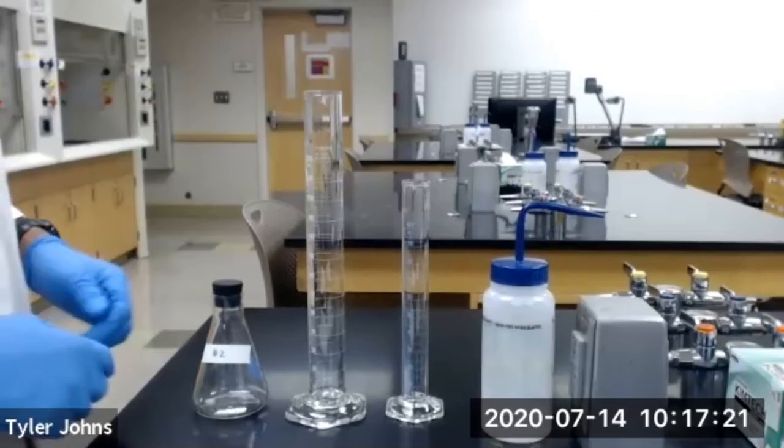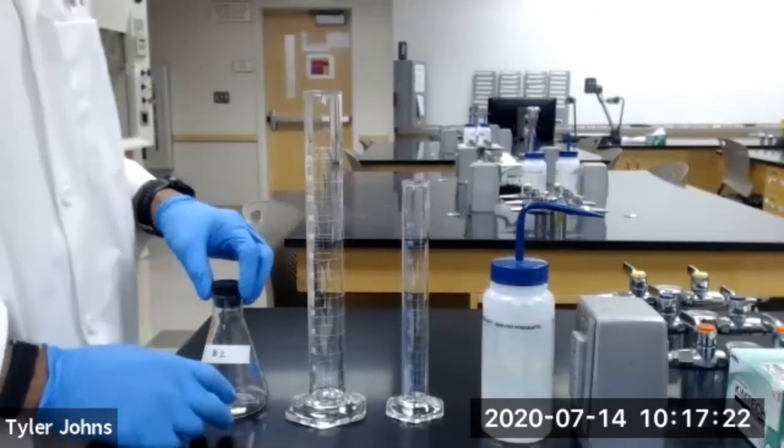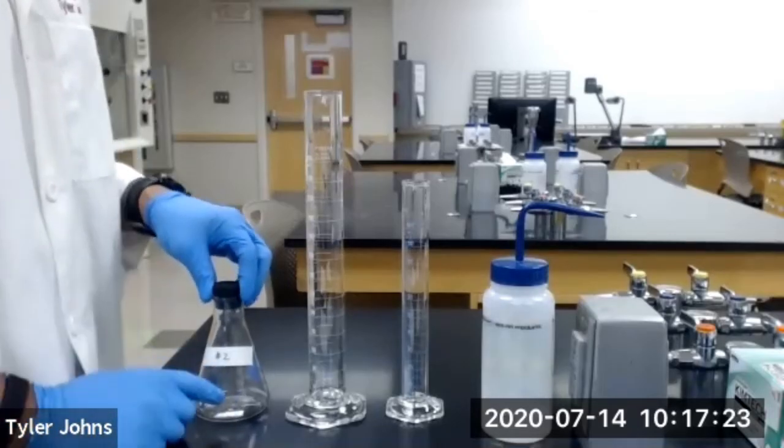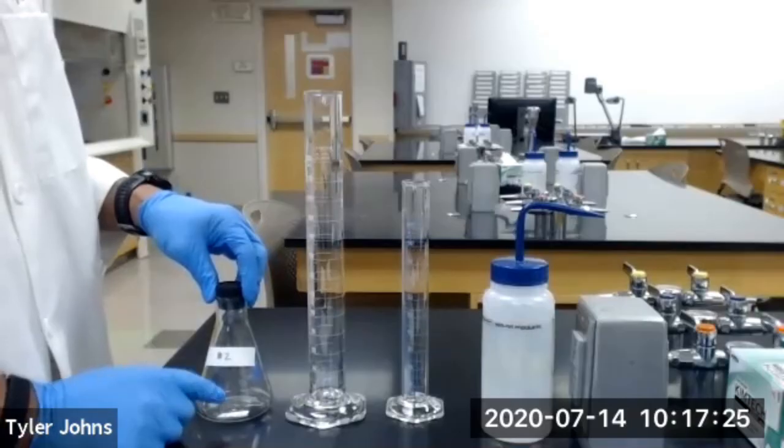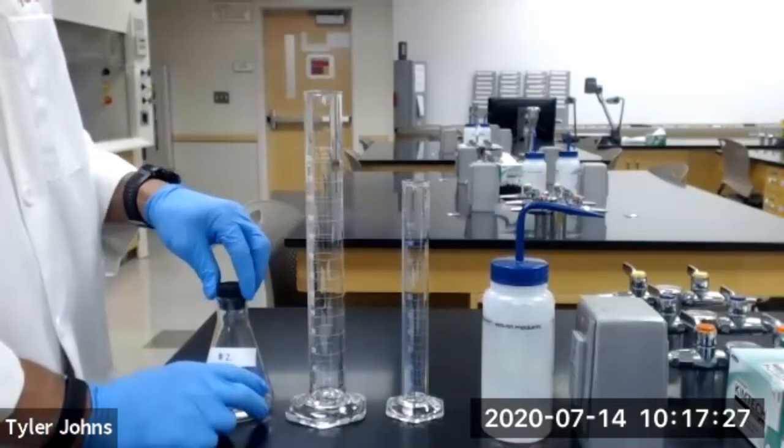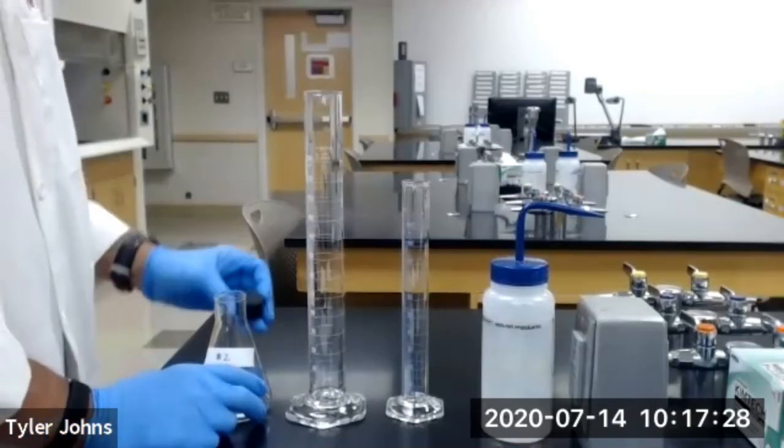We now need to determine the volume occupied by our carbon dioxide gas in our second Erlenmeyer flask.